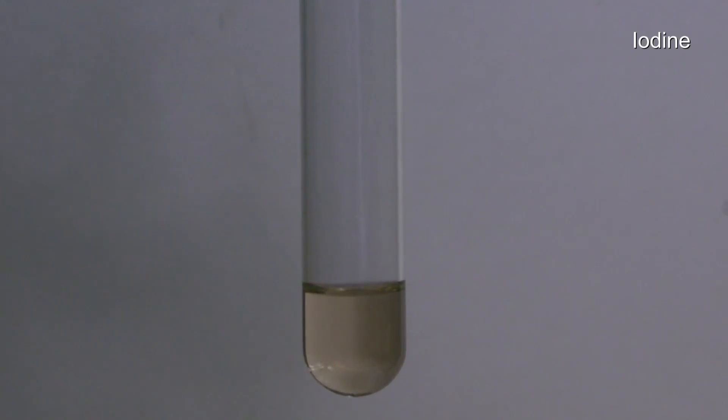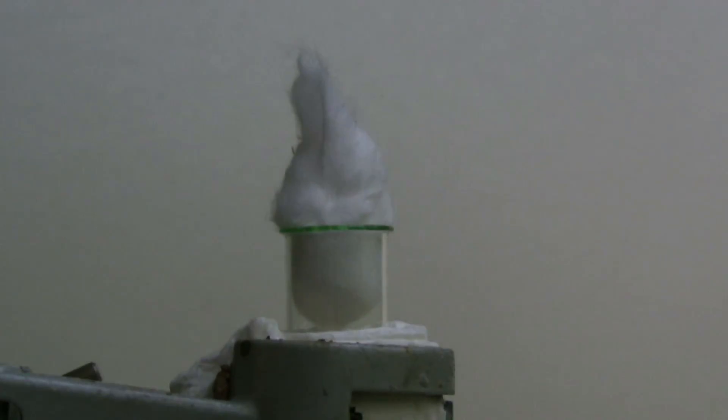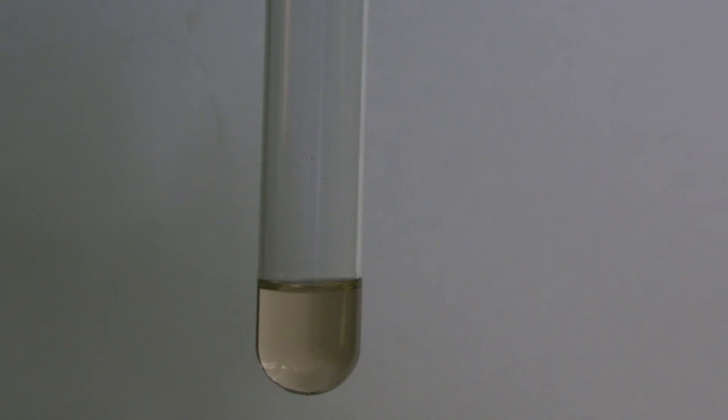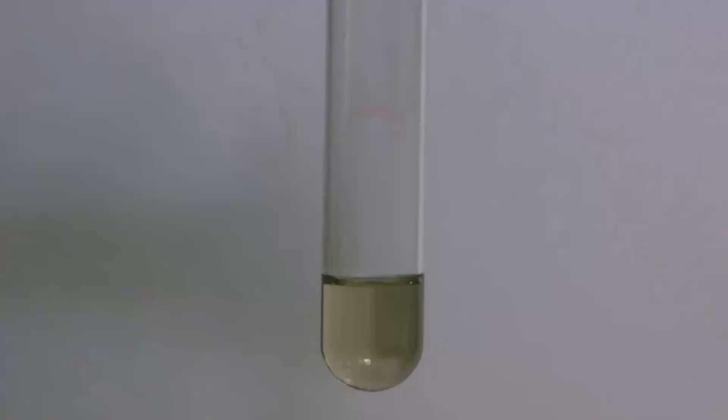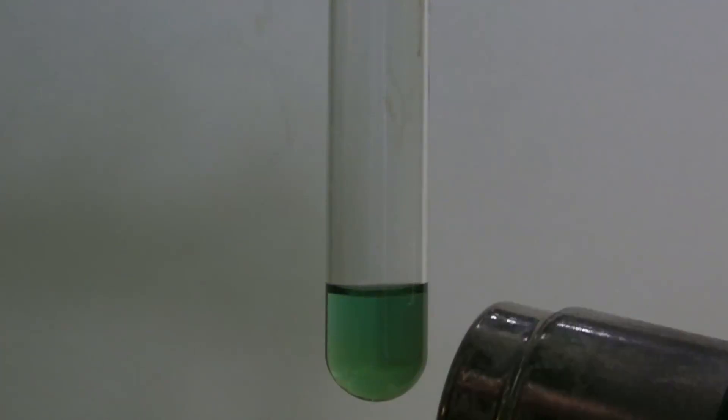Then a very small amount of elemental iodine was added. The tube was closed with cotton and the mixture was heated with a heat gun. At first the solution becomes olive green due to the brown color of the iodine and a blue greenish color, then it changes completely to the latter.